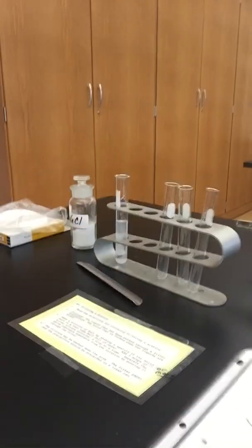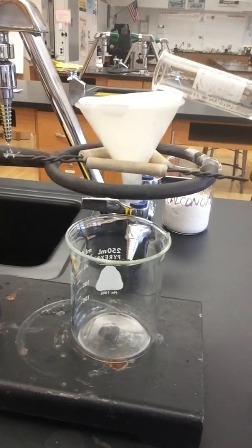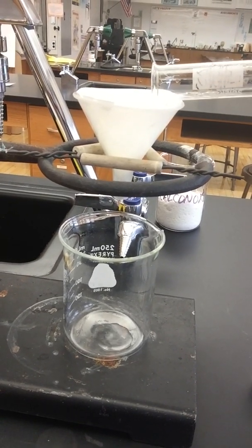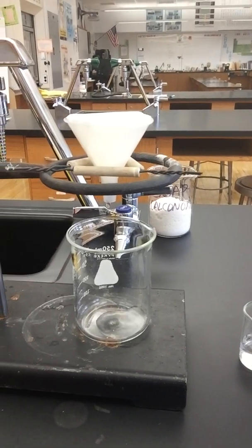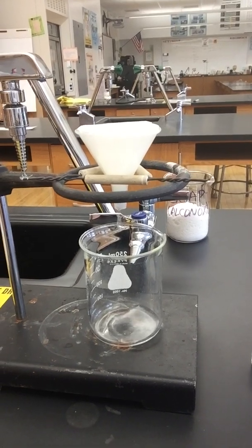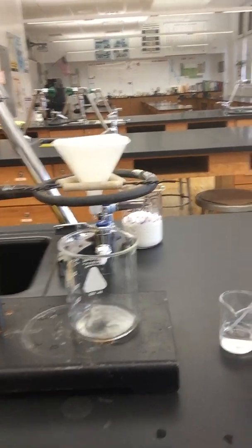So I'm going to go back over here to what I made here with the silver nitrate and the salt. And basically what I'm going to do is just pour it in. When I pour it in, some of it's going to go. And then as you can see there, it's flowing in there. It might take quite a bit of time for it to filter through. So if you start that, you can walk away and go to a different station as long as it's free, and then go back and check on it. So it could take a few minutes.